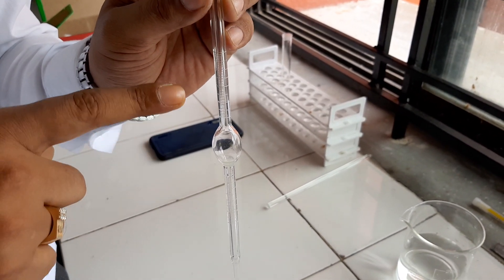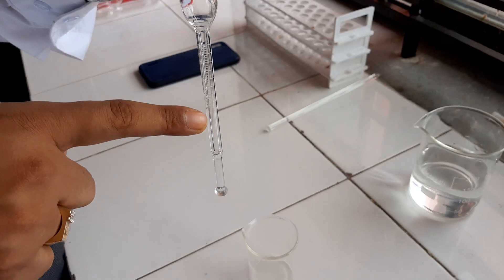In the last practical, you have already seen this is the stalagmometer. Two marks are there, one is the upper mark, another one is the lower mark.